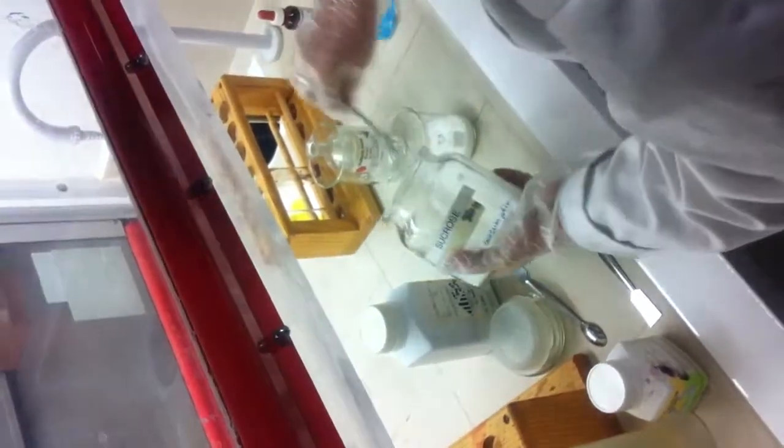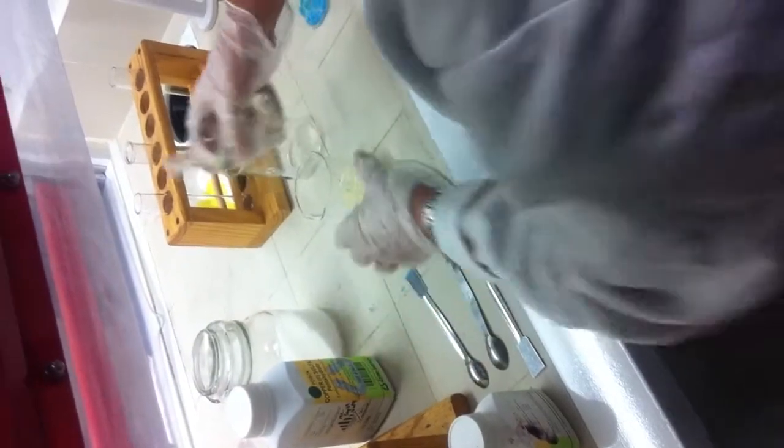One teaspoon of sugar in a small beaker, and then add drops of concentrated acid. Stand back. Oh God. I'd do my own method for this one. This one, not following the instructions, because I've done this many a time before. This makes it more interesting. That's an updated version.